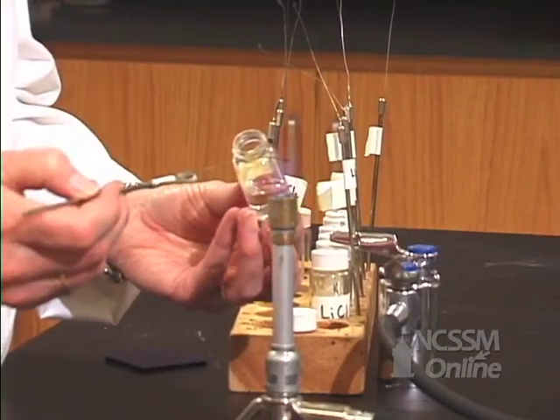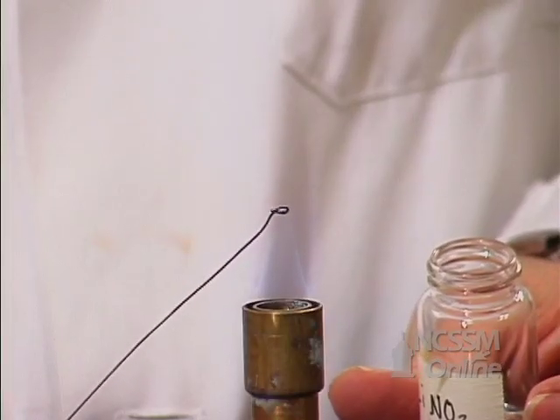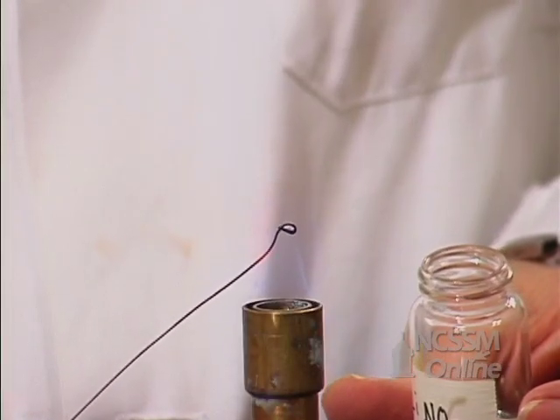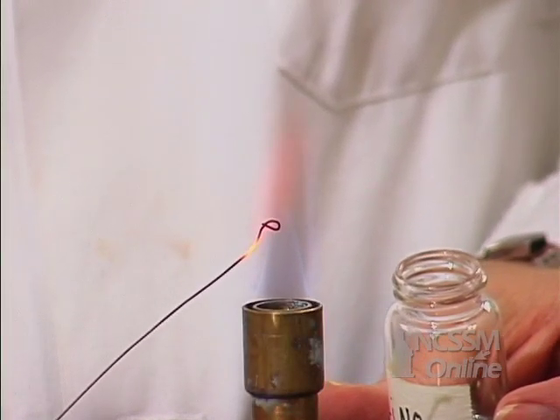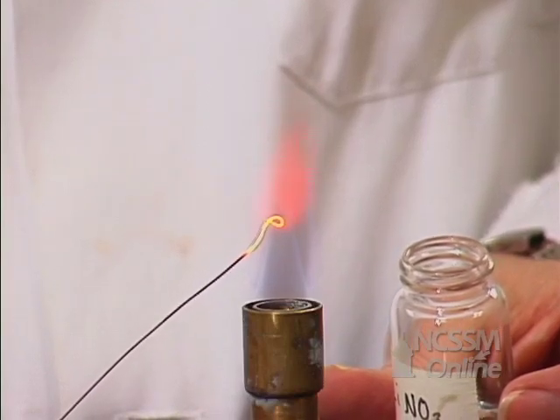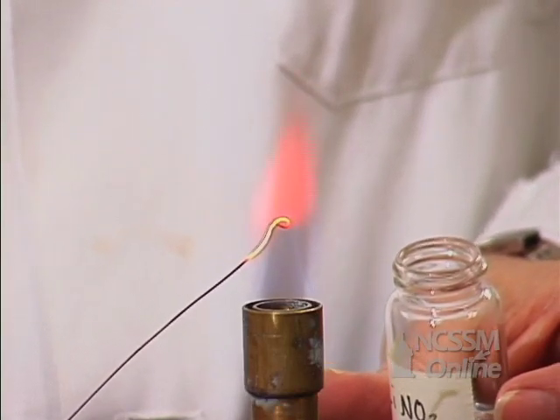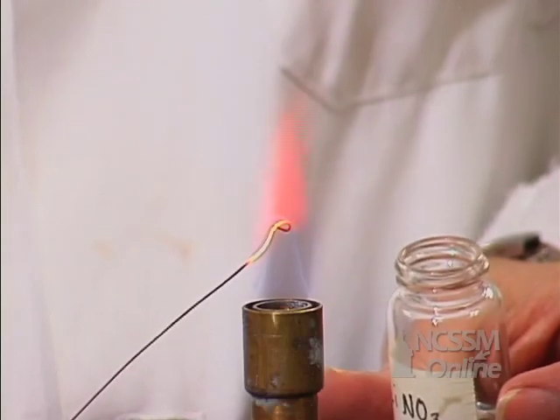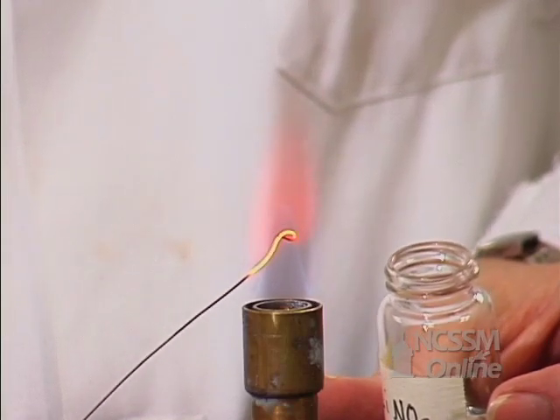If the color is the same for lithium chloride and lithium nitrate, then what do you think is the ion that's producing the color? That's pretty obvious, isn't it? It's the cation.